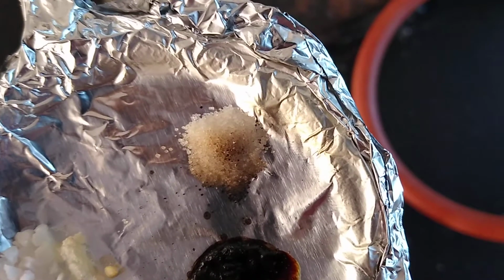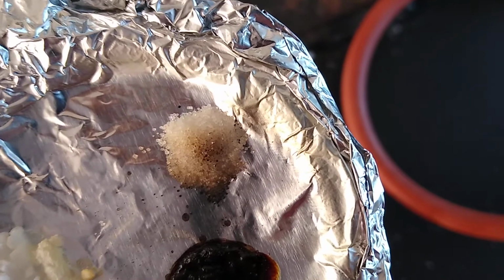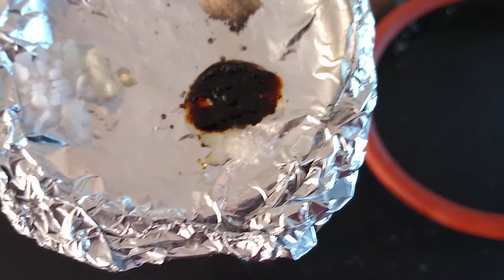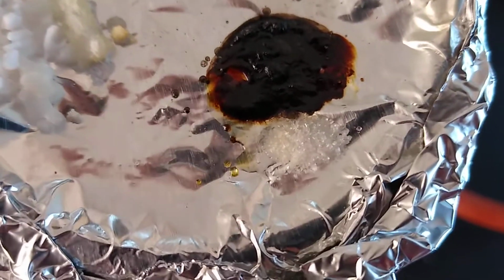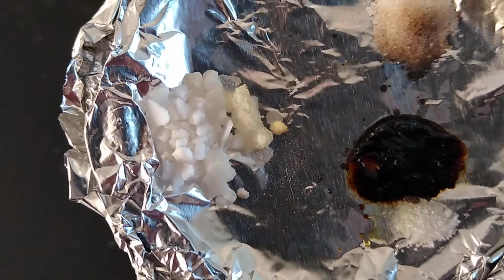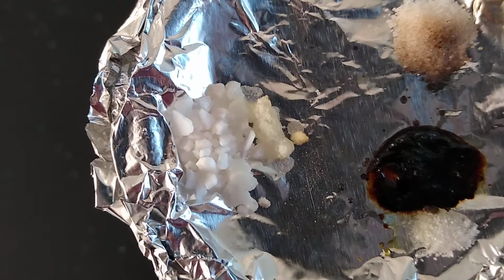they're all still crystals, okay? So it looks like they burned a little bit, but nothing about that looks melted to me. Still all very crystalline in shape. Didn't turn into a puddle like C did. And you can even see some of that still a liquid in the center there. Okay, and then again, looking at B, it looks like it sort of started to melt towards the center, but still quite a big pile of chunks there that weren't melted.